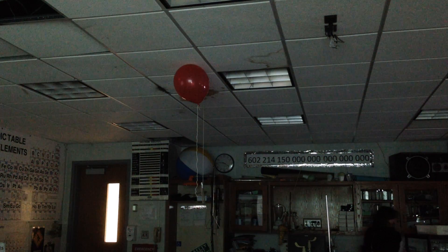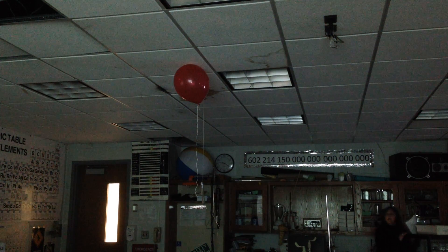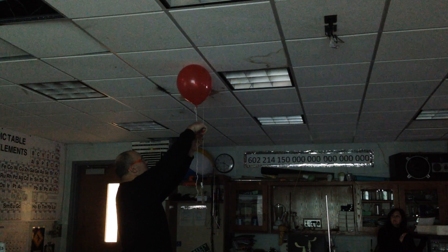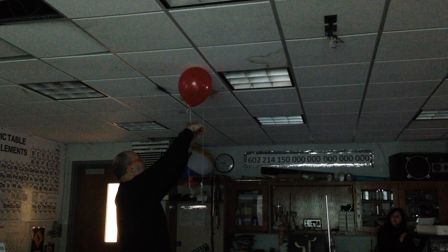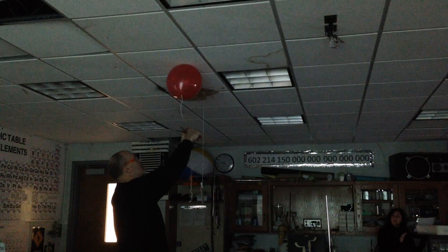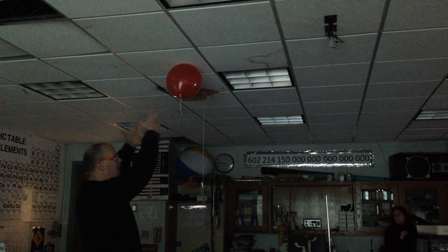So this is our hydrogen oxygen explosion. We have a two to one ratio of hydrogen gas to oxygen gas and I'm going to ignite it and we're going to see if we get a pretty good bang. Now most hydrogen reactions are, how can I say, a good pop but not very impressive in terms of sound because the hydrogen is looking for more oxygen.